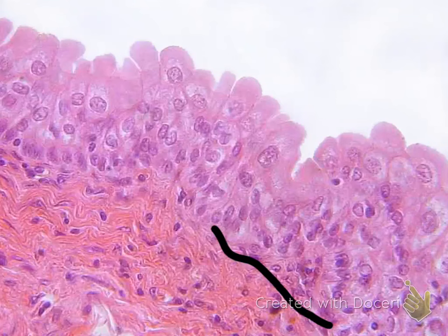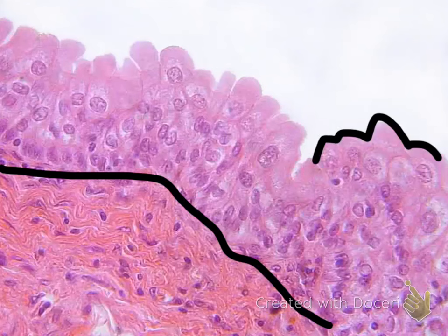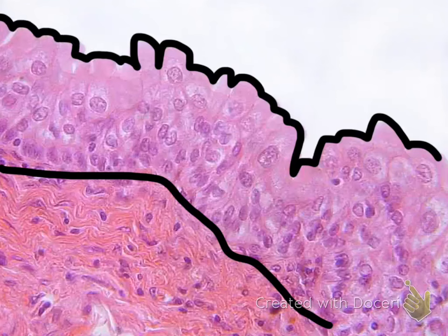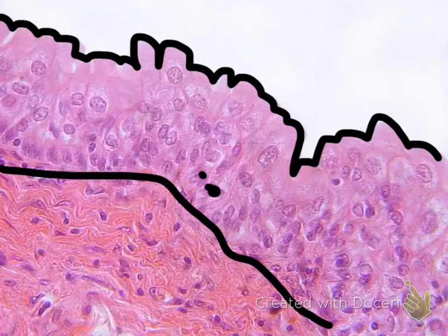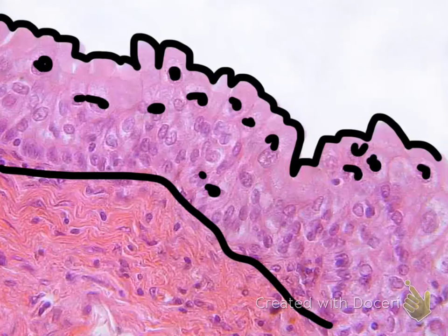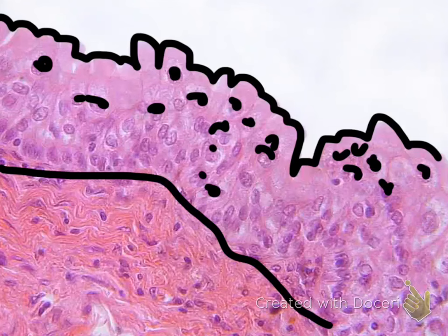Basement membrane down here. You have this scalloped dome-shaped apical surface, so automatically when I say scalloped or dome-shaped apical surface, you should be thinking it's transitional. If that's not a clue, look at the nuclei — they go all the way to the apical surface. It is the only epithelium where the nuclei go all the way to the apical surface. This is transitional epithelium, which is not distended, meaning it's not stretched.